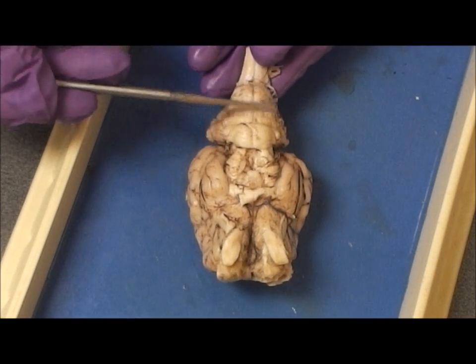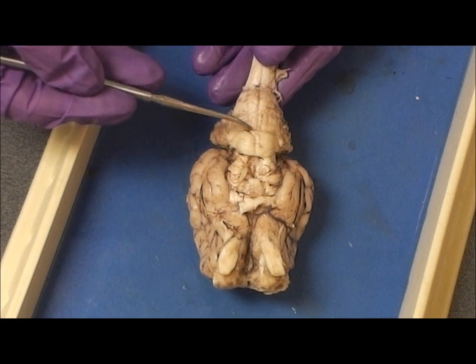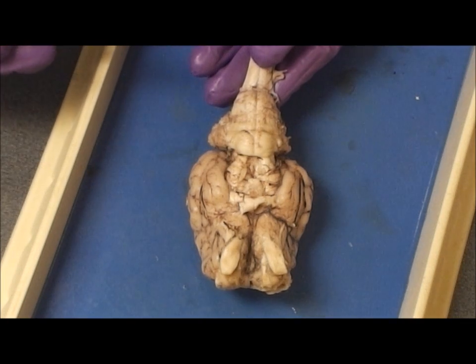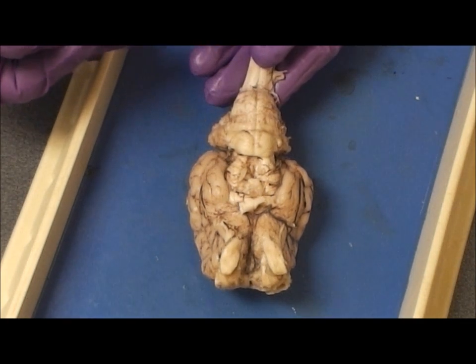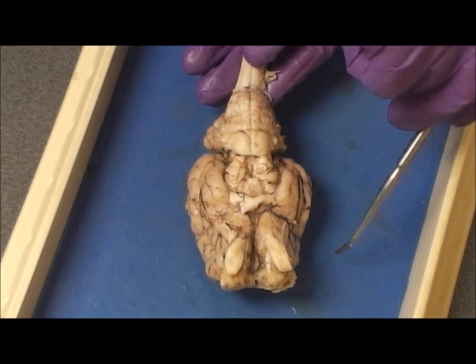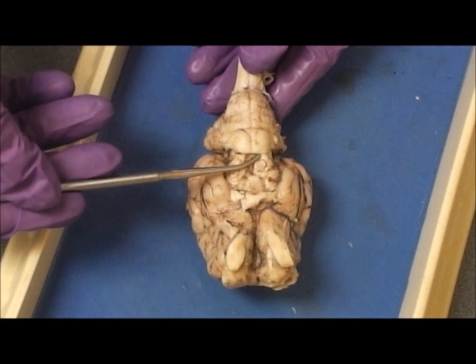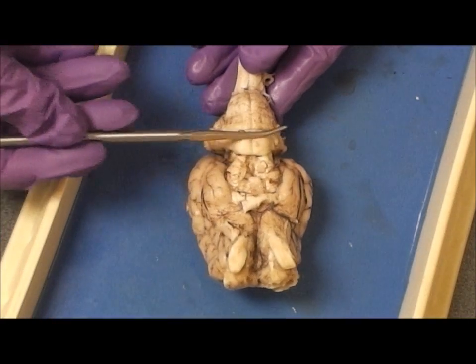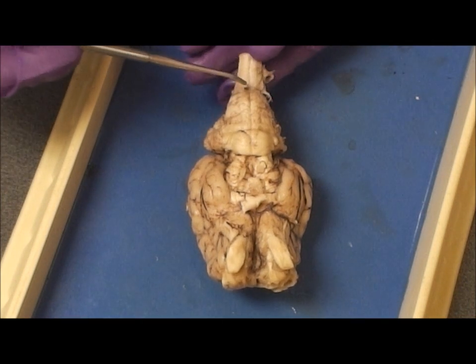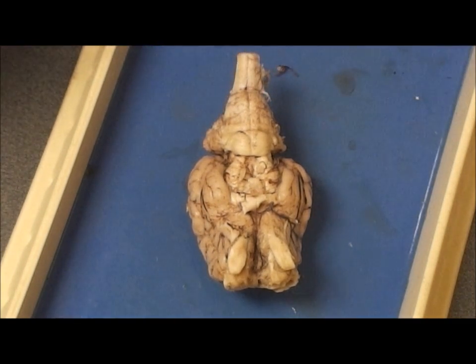Caudal to the pons is part of the brain stem, the medulla oblongata. On the surface of the medulla it looks like two glass noodles glued to the surface. Those tracts — that white matter — are the pyramidal tracts. Those are continuations of the corticospinal tract coming from the cortex, traveling down through the cerebral peduncles in the midbrain, ducking under the transverse fibers of the pons, and appearing on the ventral surface of the medulla oblongata. Then they decussate and continue down the spinal cord as the corticospinal tracts.